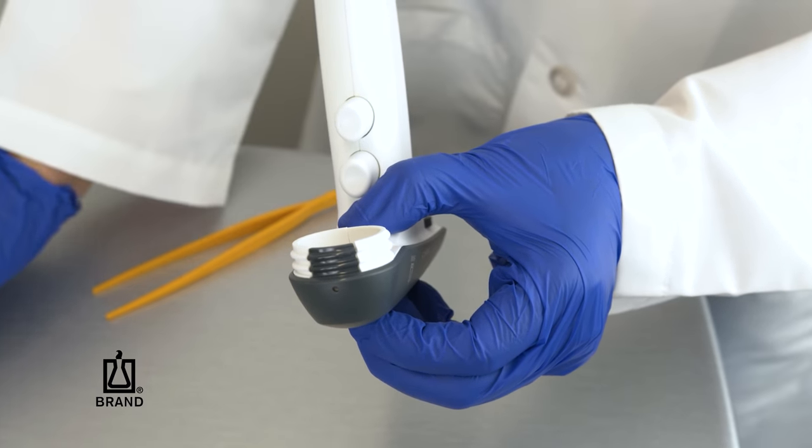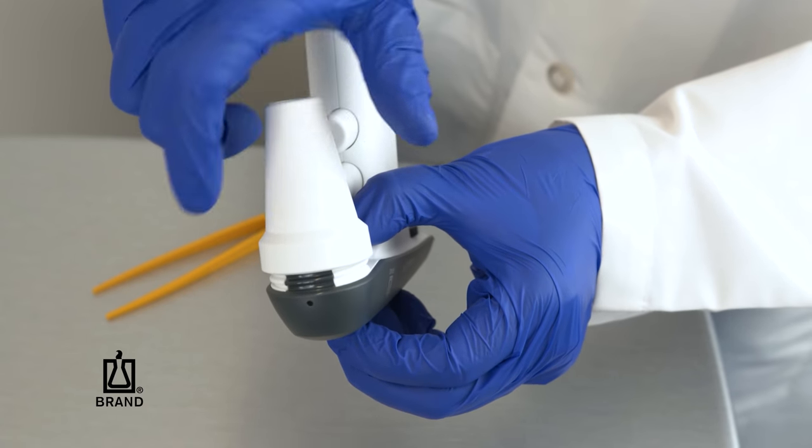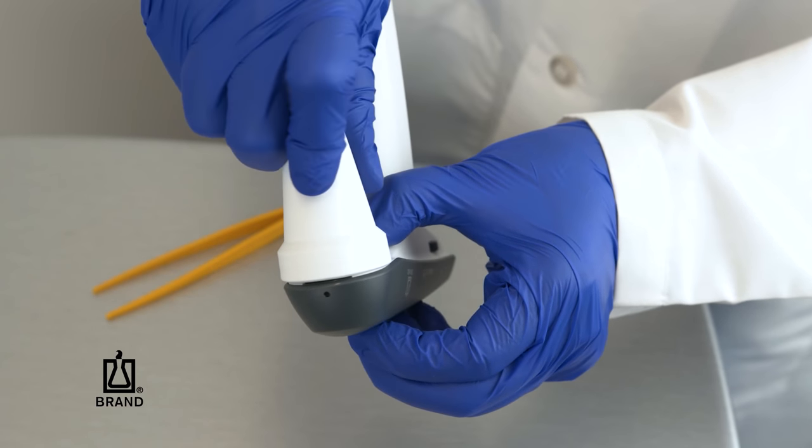Press gently on the housing cover until the threads align, allowing the adapter to screw into place.